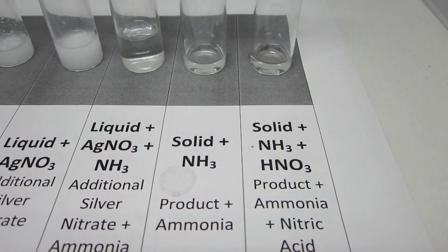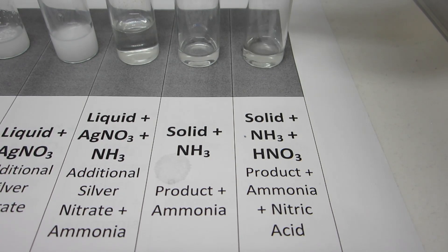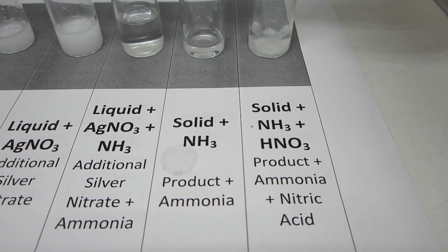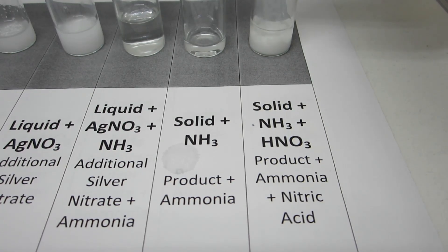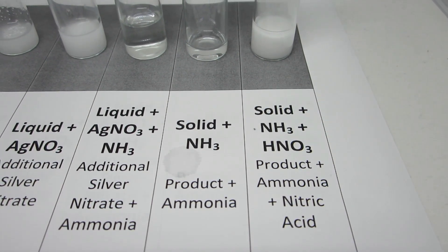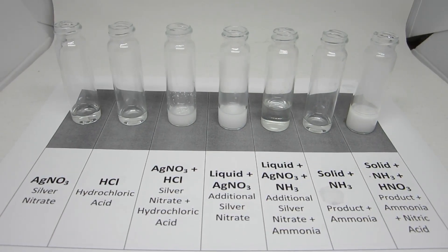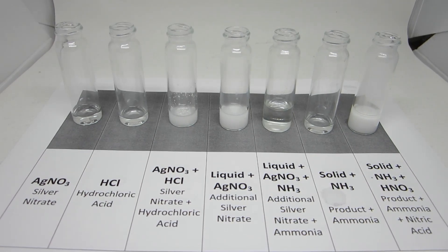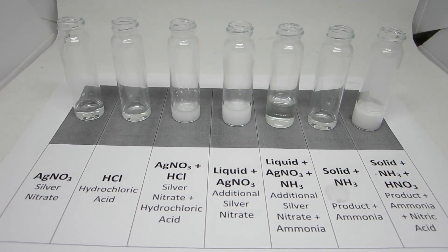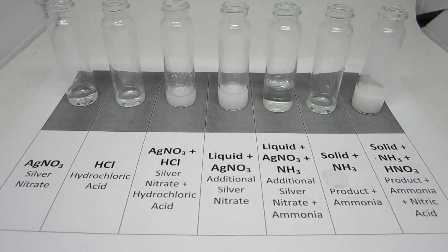To the very last vial, nitric acid is added. The nitric acid reacts with the ammonia. As the ammonia reacts with the nitric acid, it is no longer available to bind with the silver ion. This causes an increase in the silver ion concentration and therefore drives the reaction toward the product of silver chloride. Overall, clear and colorless silver nitrate and hydrochloric acid are reacted together to form the white precipitate of silver chloride. The liquid itself still contains chloride ions, as the silver ions were the limiting reactant.